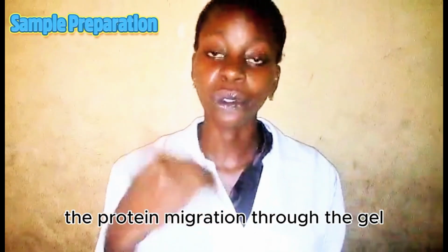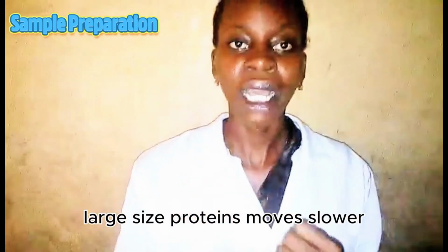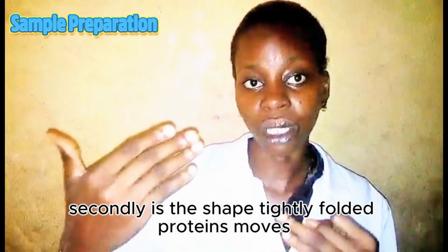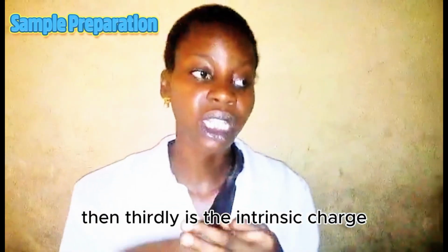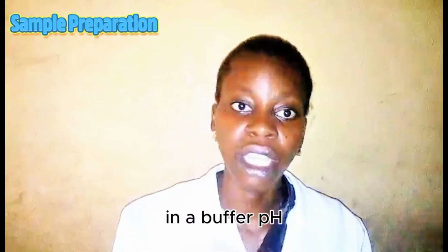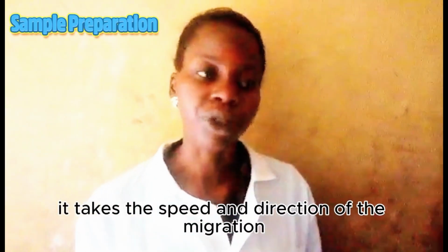Then the protein migration through the gel depends on three factors. Firstly is the size. Large size proteins move slower. Secondly is the shape. Tightly folded proteins move faster than the loose ones. Then thirdly is the intrinsic charge. The natural electric charge of the proteins in a buffer pH determines the speed and direction of the migration.